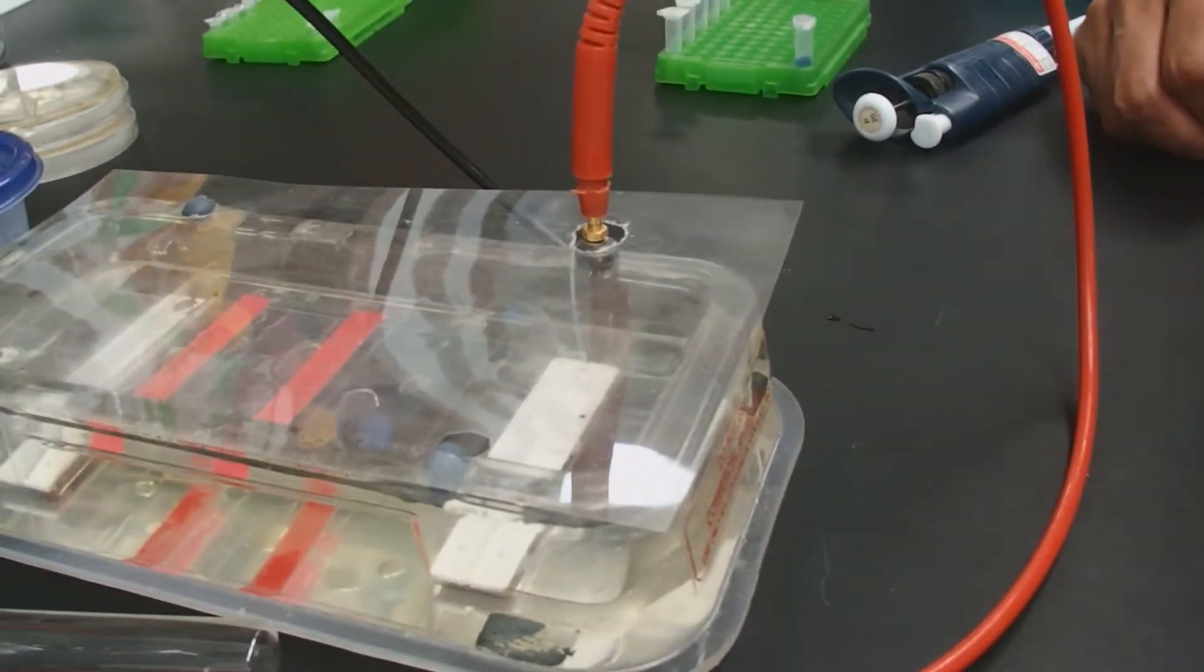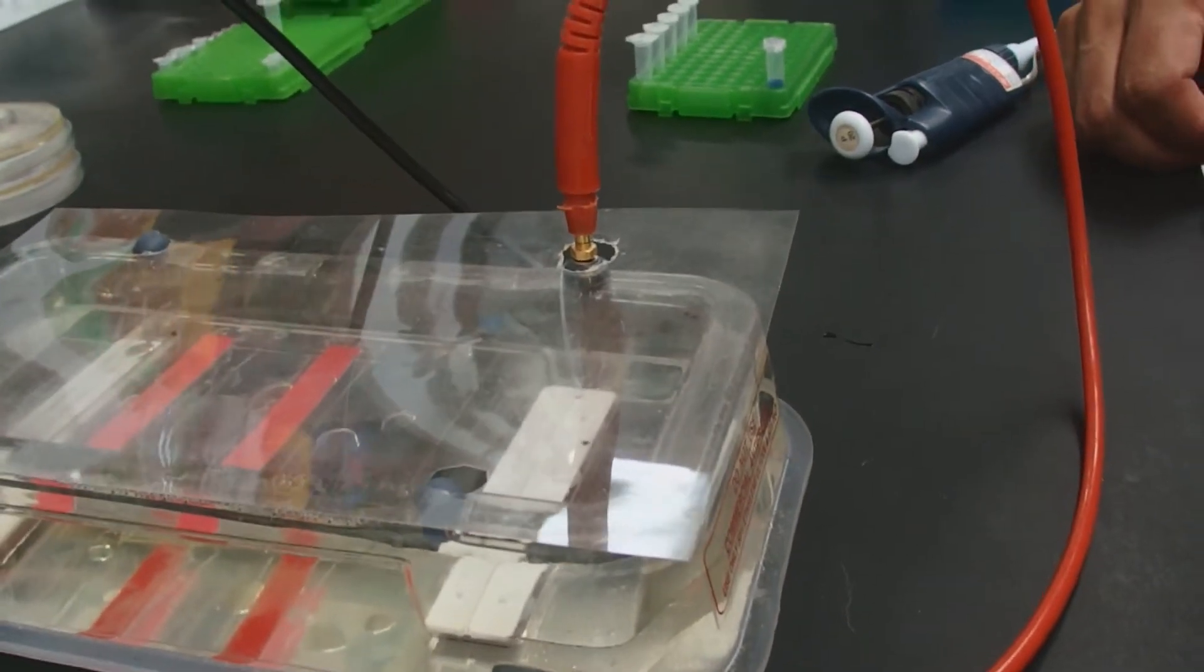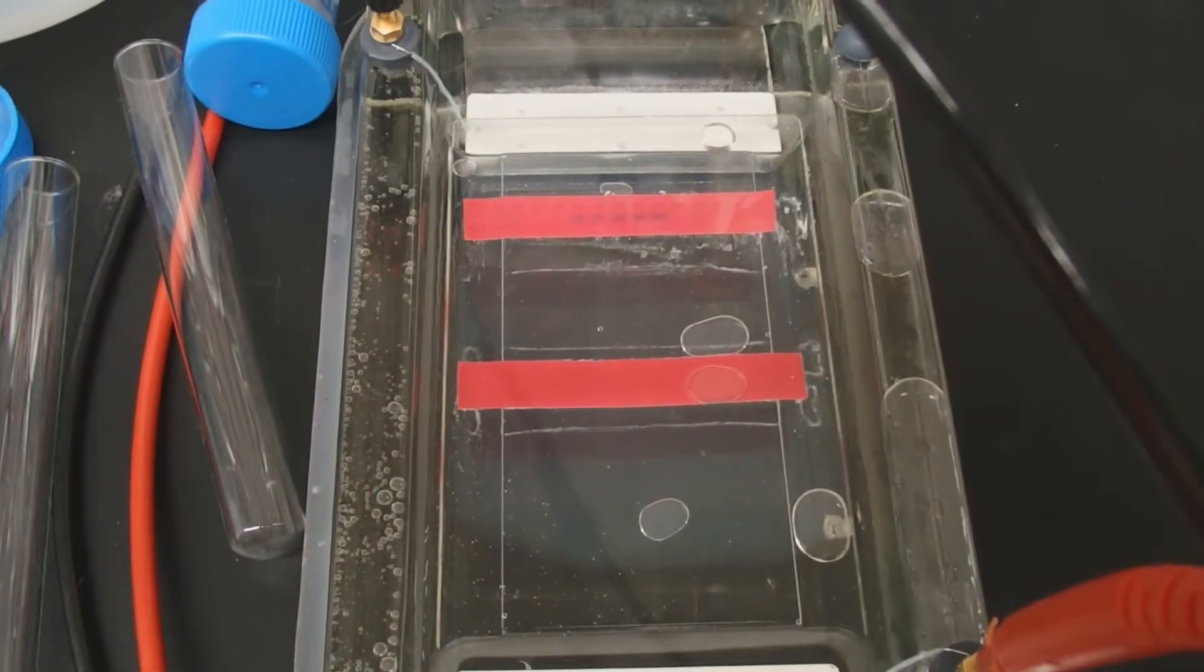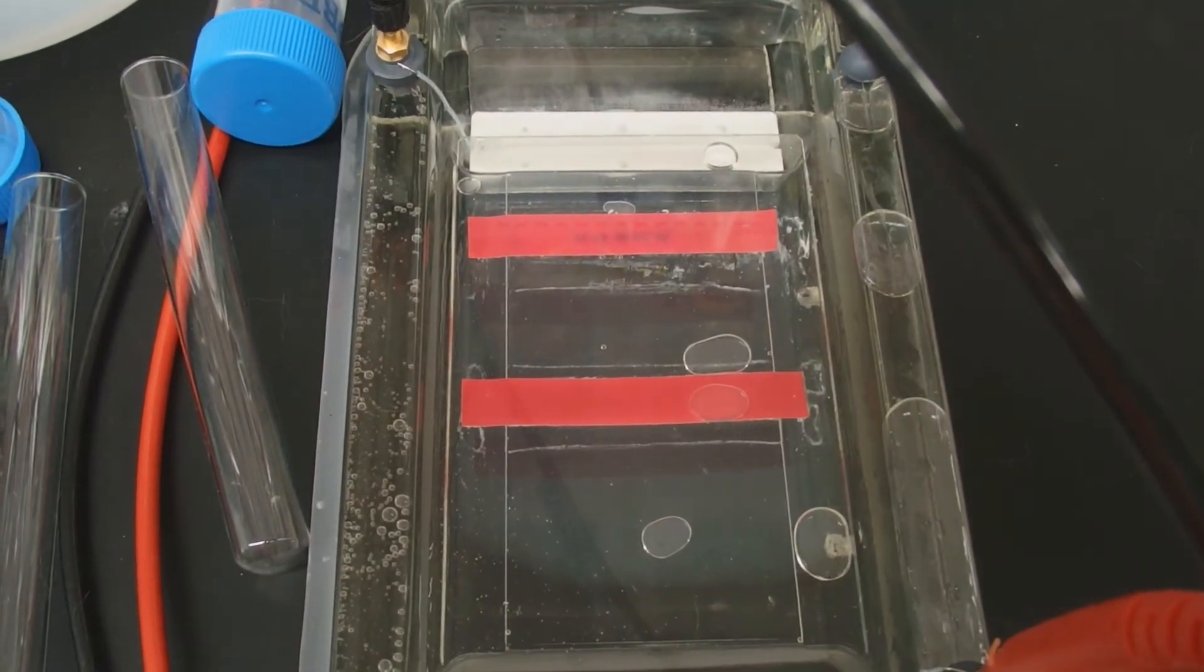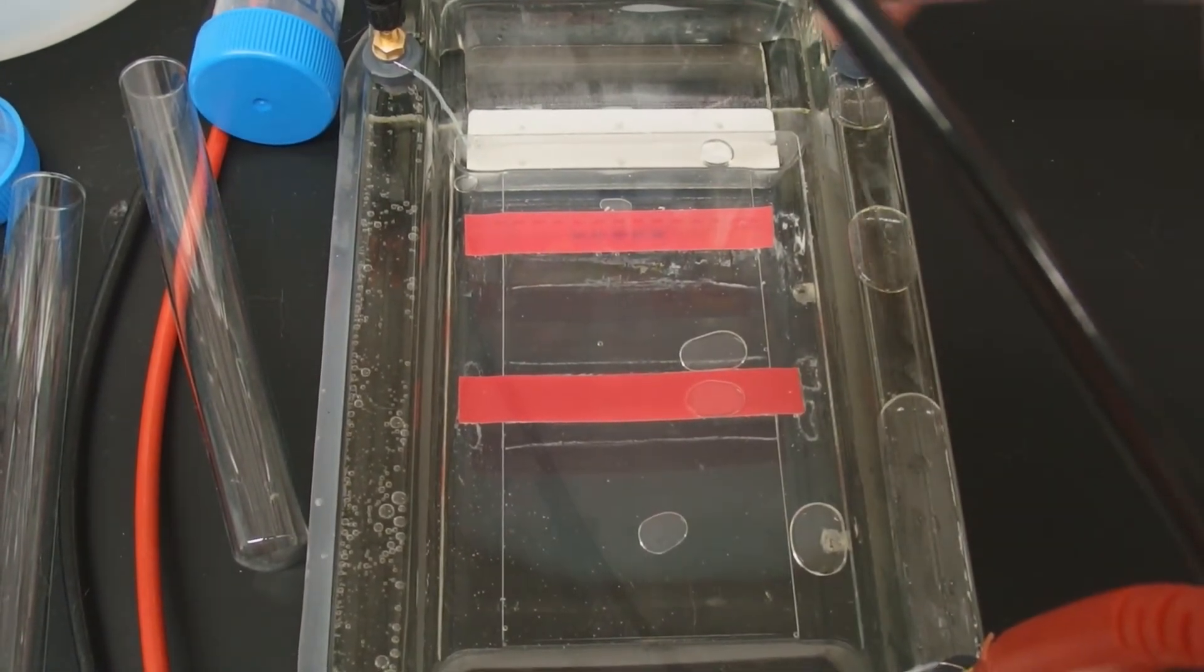There it's running. It will come back when this is done. All right, if we run the gel with the lid off so that you can easily see what's happening, you'll notice there's a whole lot of bubbles coming from the electrode.